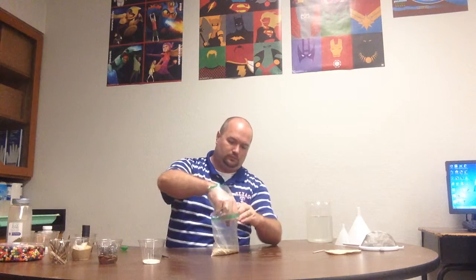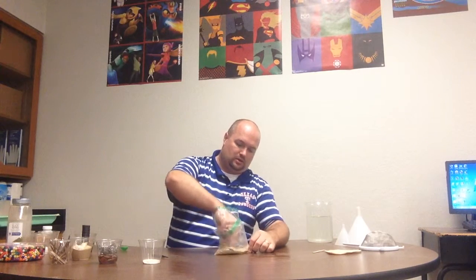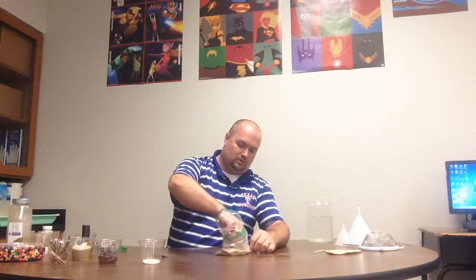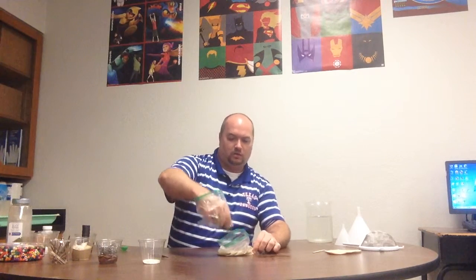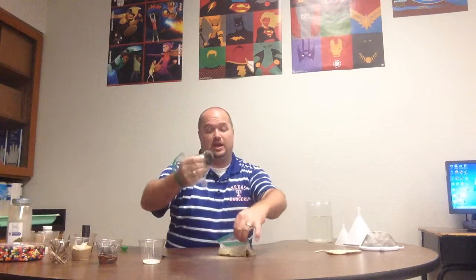However, and thank you, Miss Shelby Thayer, for teaching me this trick. If you put the magnet, and I'm actually going to trim my magnet down so it's not so bulky, I'm just going to use 3 of them. If you put the magnet inside a baggie, see all that? Now I've got my iron filings.